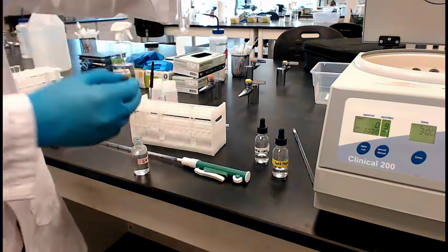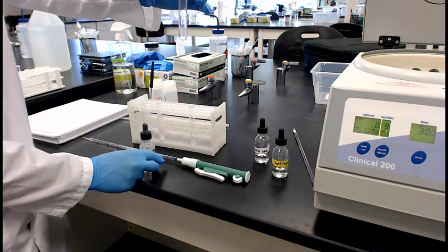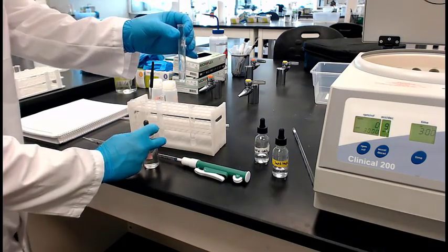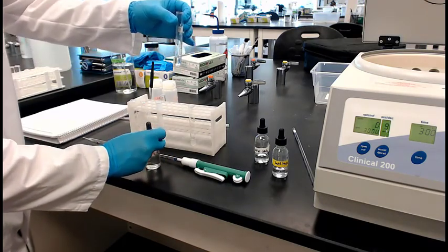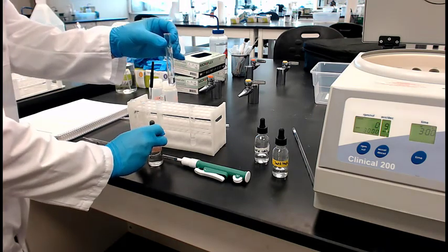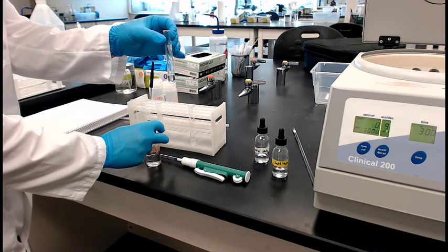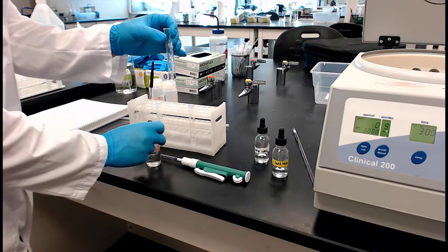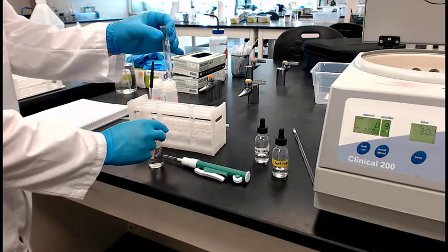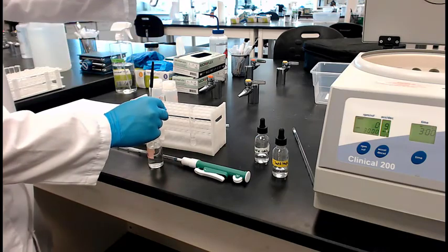And if I could see that, now I would tell you to put your attention on the Chem 111 reaction here. This will help you understand this. Because you're actually interacting hydrochloric acid with carbonate, dissolved carbonate anions, and it's going to make something that in essence removes the carbonate anions. So if carbonate's going away, which way is the equilibrium going to shift? We're about to find out.